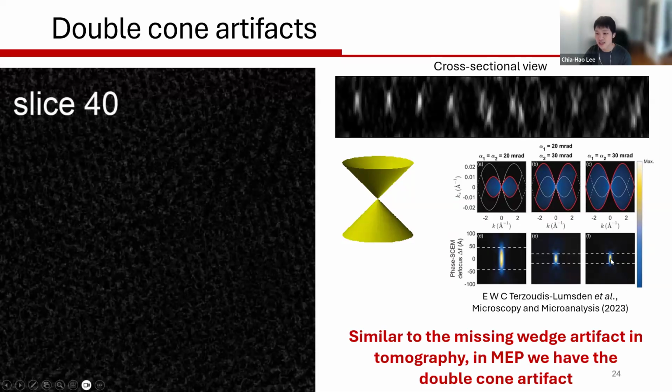Once you start increasing the convergence and collection angle, this thing gets sharper and sharper, and these angles get wider and wider. Most of the time, you're seeing this very clearly because I'm using a 1 angstrom slice thickness. But for typical multislice ptychography with a thicker sample, usually you'll only see this at the very top and bottom slices, which we usually discard or pad with vacuum. But this is something to keep in mind: technically, for each single atom you resolve, you actually see this X shape in the cross section. If you pull up the 2021 Chen paper on multislice electron ptychography and look at the substitution atom that they resolve, you can see similar tails, or the double cone artifact, as well. And I think this is fundamentally limited by the optical condition.